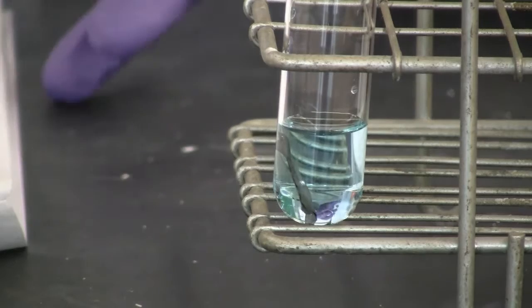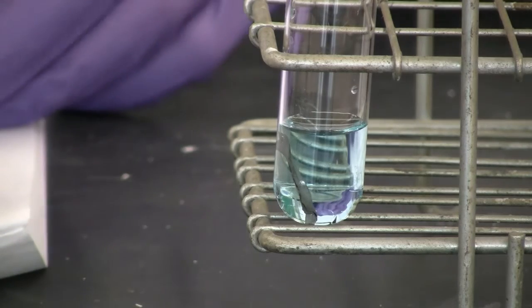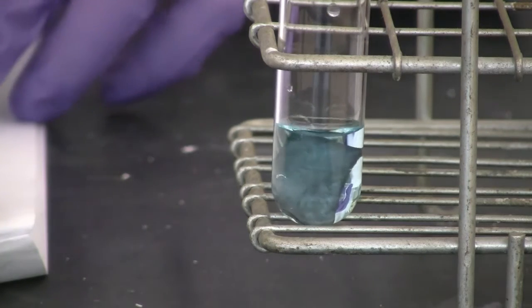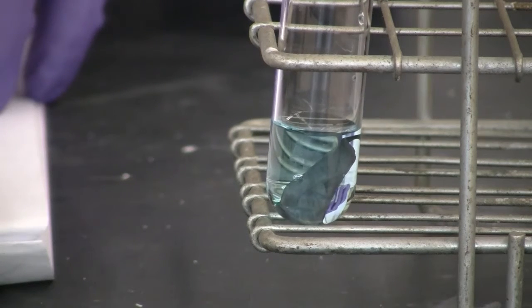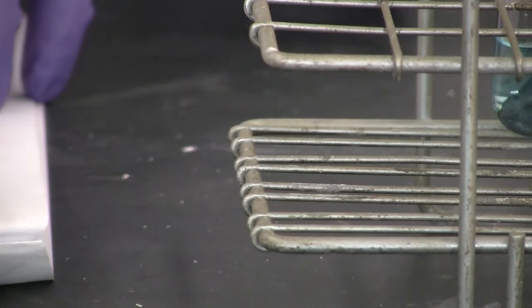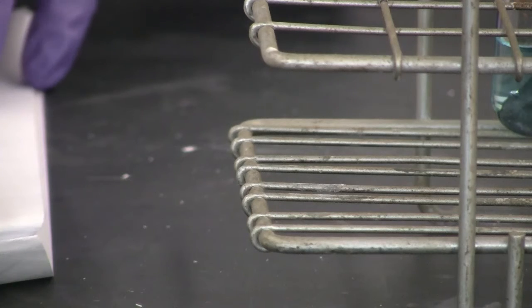So this is reaction 13, but I'm going to go back. I'm going to let you revisit the change later, maybe more dramatic. Okay, I'll leave it temporarily away for a while. I'll show you a little bit later. So now let's move to reaction 14.